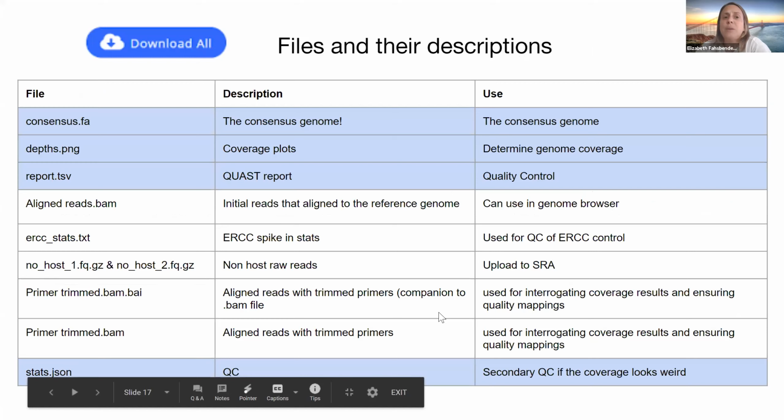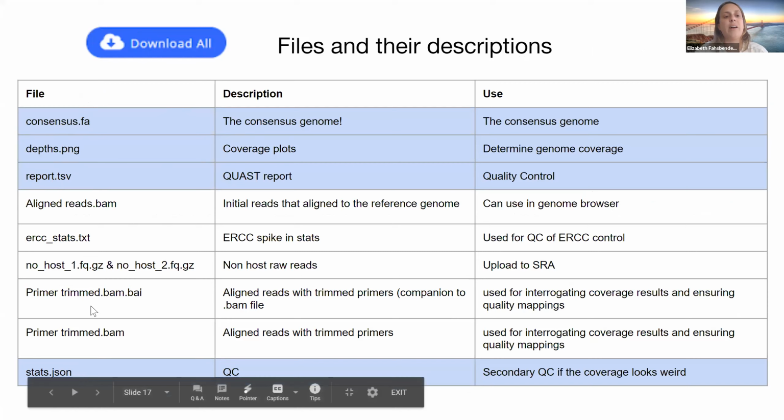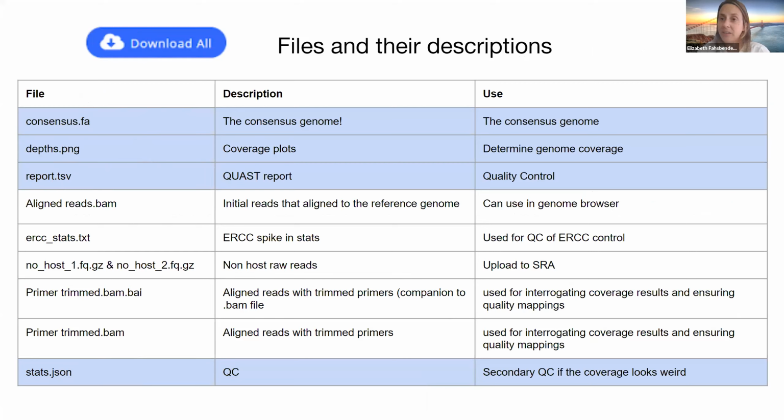Okay, so then we also provide these output files with this download all button. And there is documentation for everything I'm going over in our help center, which I'll give an address to at the end. But these are the files that we provide, and the ones that are highlighted in this light blue color, these important metrics, are available in the user interface, the ones I just went over.